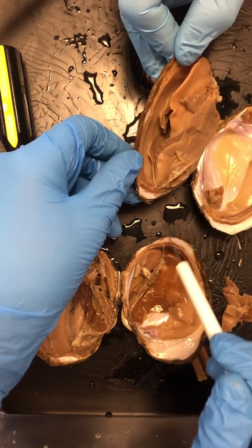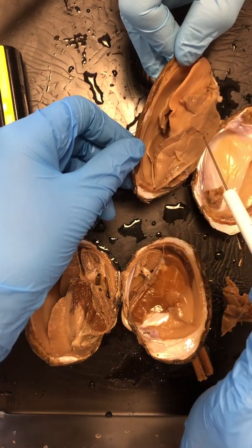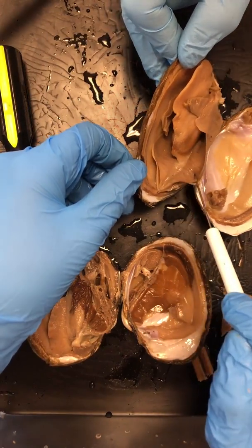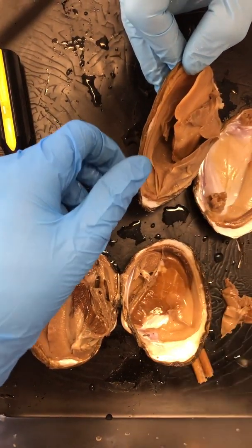No, that doesn't make sense. I was right. I'm sorry. Water comes in over here, travels across the gills, comes back out. But these gills here, their purpose is to breathe. Everything's got to breathe, but those are doing the breathing.